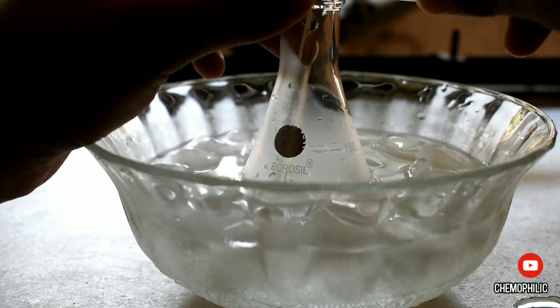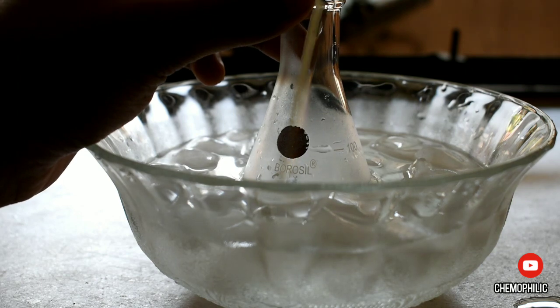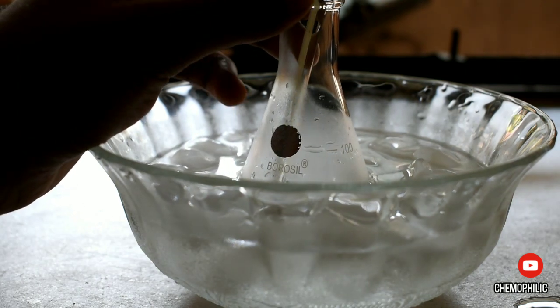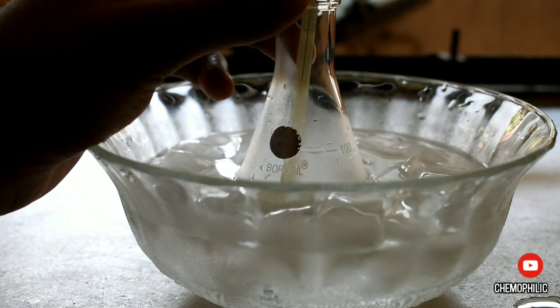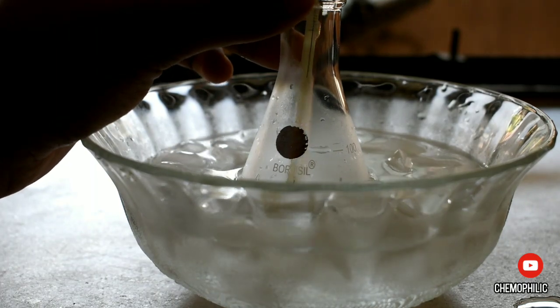Then the chloroform was slowly added in parts in order to keep the same temperature.